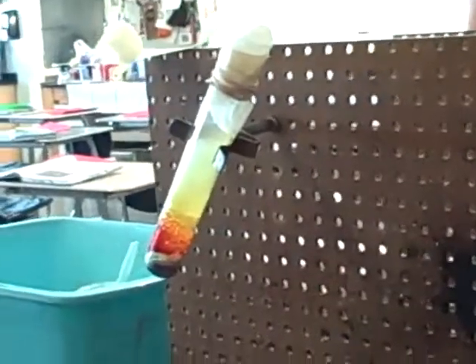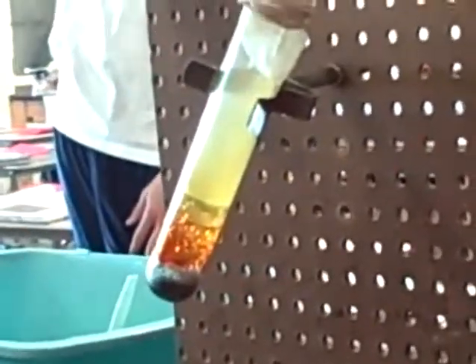So we're now gonna take notes. As you can see, the thing blew up. There was yellow smoke. It glowed. There's like red liquid on the outside, yellow gas. And there's obviously a new solid because it's burnt now — it's not the same color, it doesn't look the same.